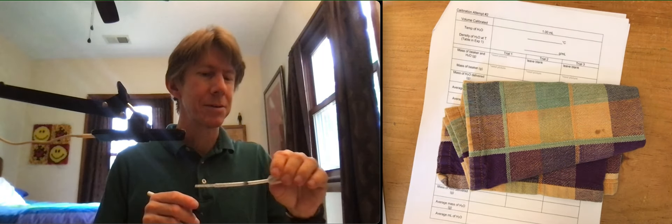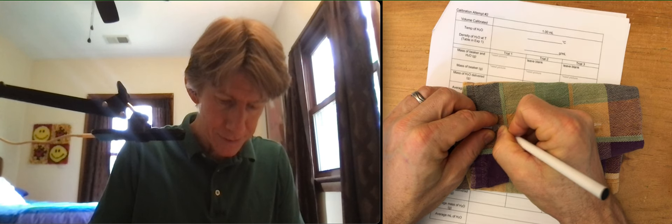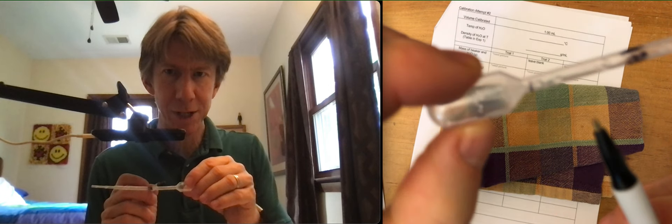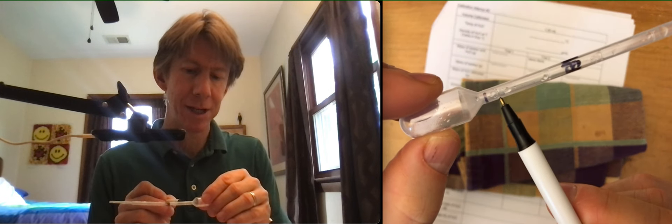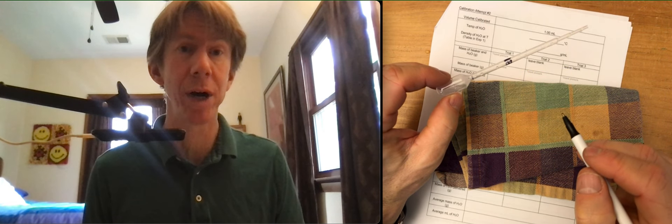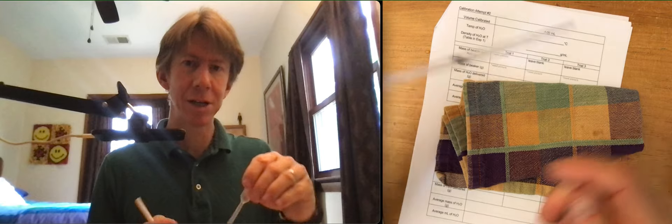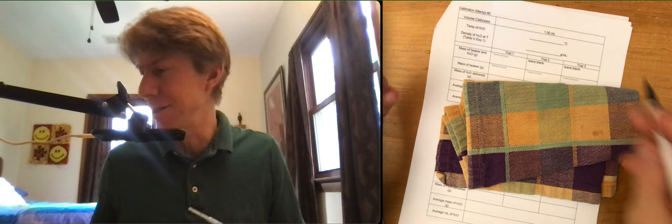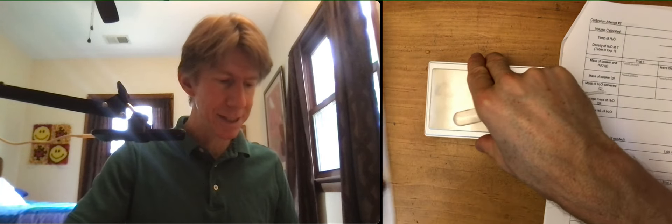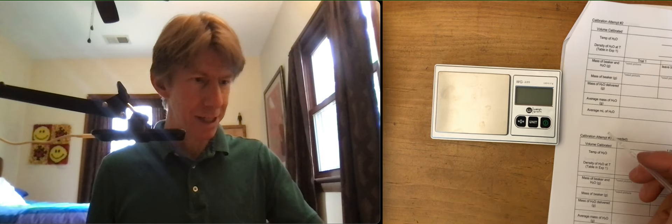I'm just going to go over this 10 or 20 times. And just to show you, that's my line, my new line. And then right here is where 0.96 was. Because that's where the one mark is. The little indentation or raised part on the actual pipette itself. So I've gone a little higher because I want a little more volume. Rearrange my workspace here. And then go back and do it again. Looks like this. Take your beaker.